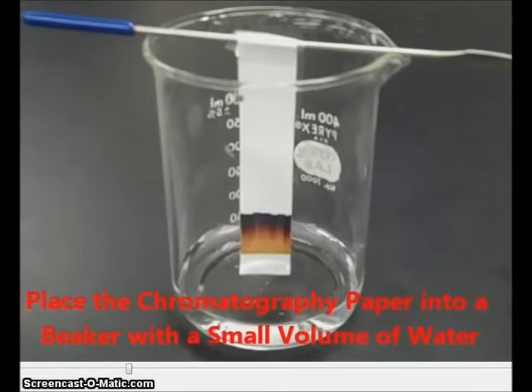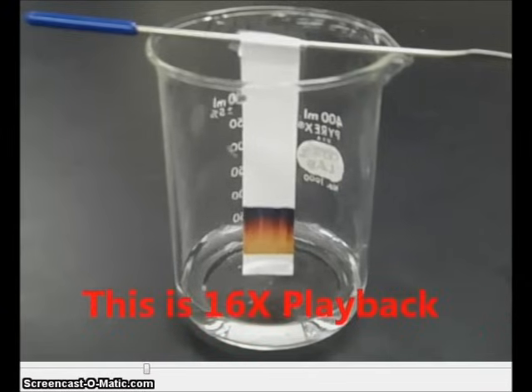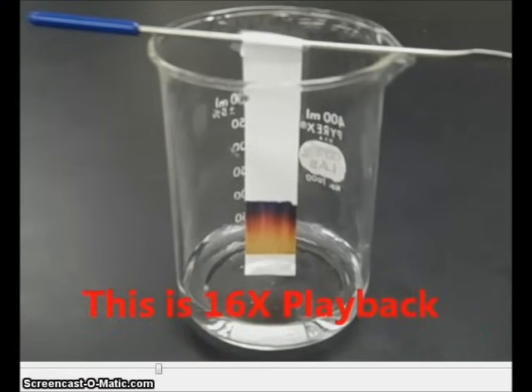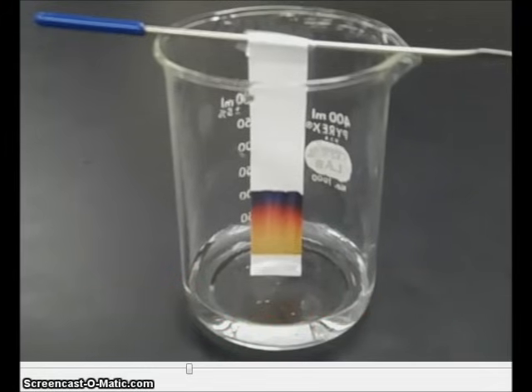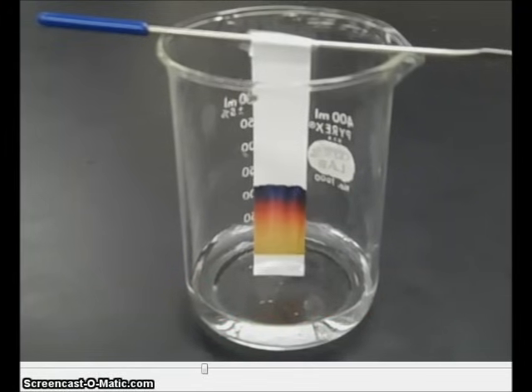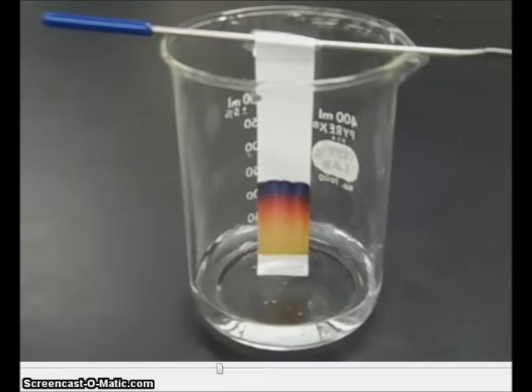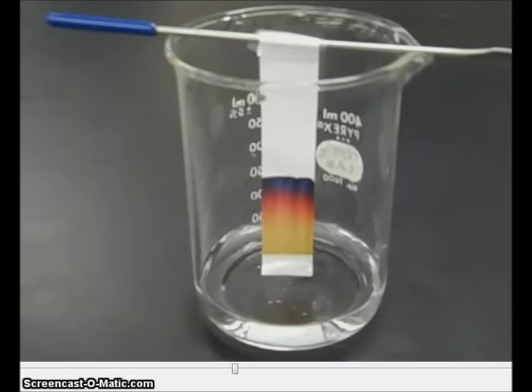We can see that the water will start to rise up the chromatography paper because of capillary action. You'll notice this happening very quickly because this is 16 times speed playback. We can see that the ink, which originally looked black, is starting to separate into different colors.